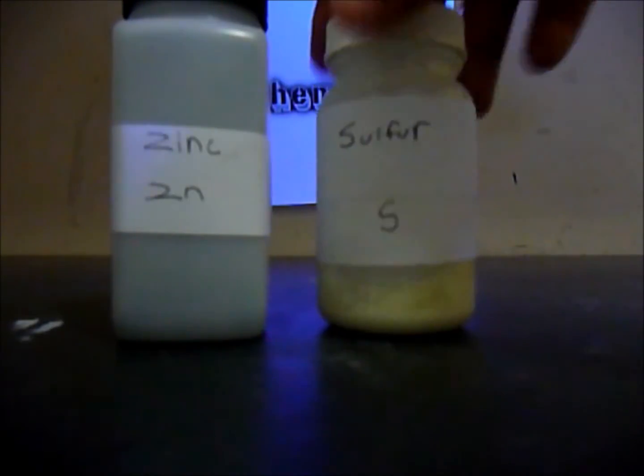Hey guys, today I'll be showing you how to make zinc sulfide. So the chemicals you will need is zinc and sulfur.